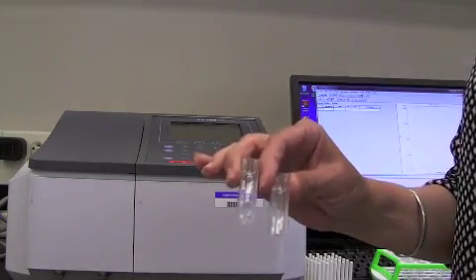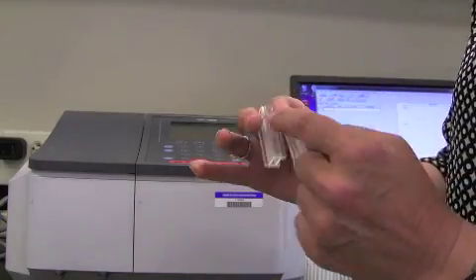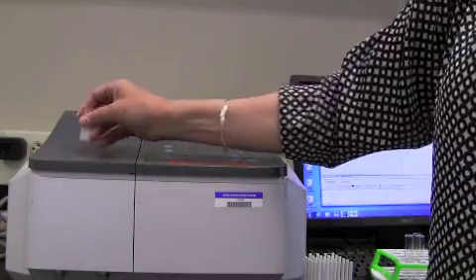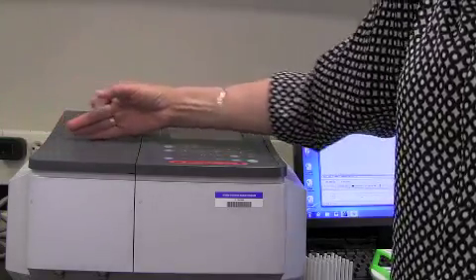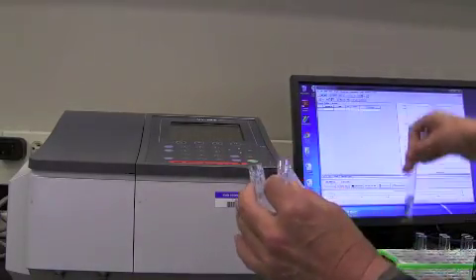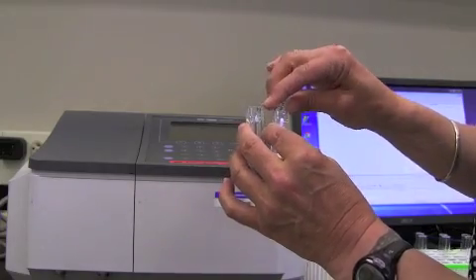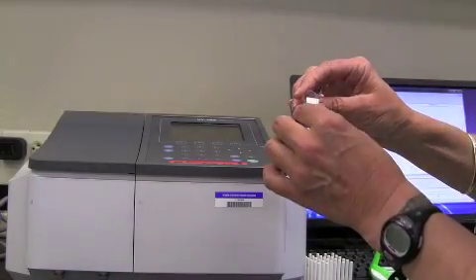And again, we're going to work closely with you to make sure that you use these correctly when you get to it. But if you look at them closely, you'll see that they have a clear face and an opaque face. And the clear face is the one that's going to be facing the beam, which is actually running parallel to you if you're standing in front of the spectrophotometer. So, we take our 0 tube contents and we pour it equally into 2 plastic cuvettes. Just pour a little bit into there.